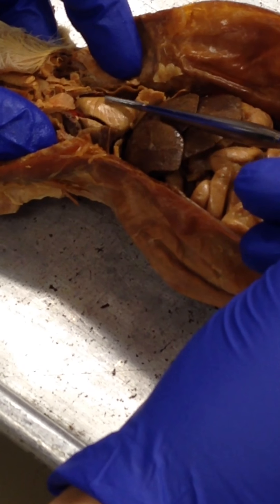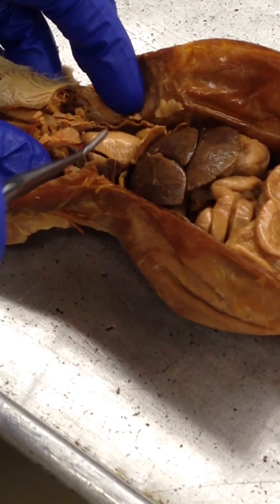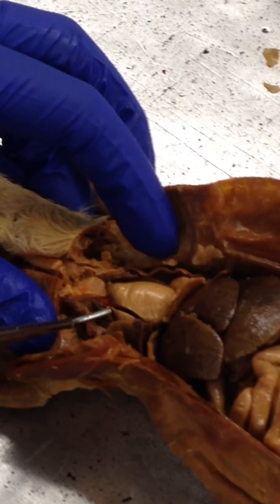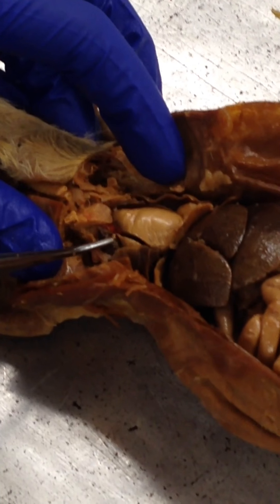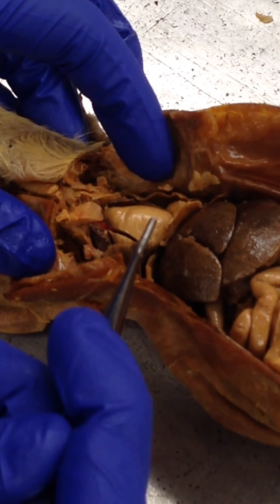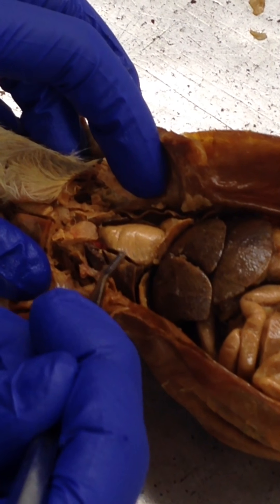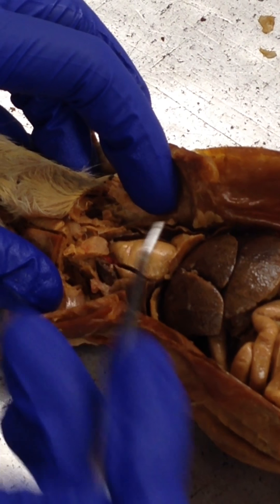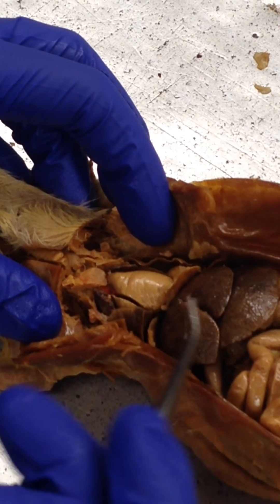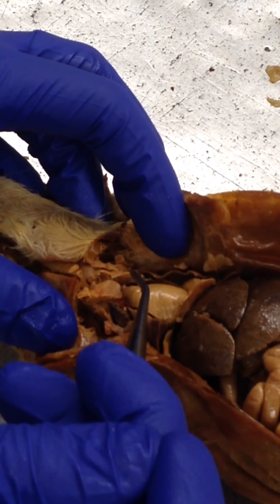And then the heart is this entire thing. Here is the right atrium — it's the dark brown structure. And then the right ventricle is going to be right here. And then the left ventricle is right here. And then this is the left atrium, the dark brown structure.